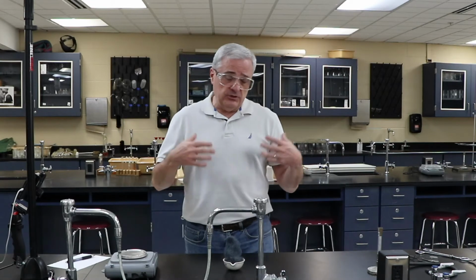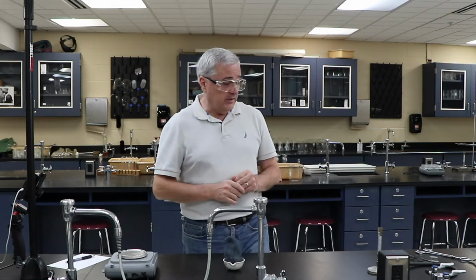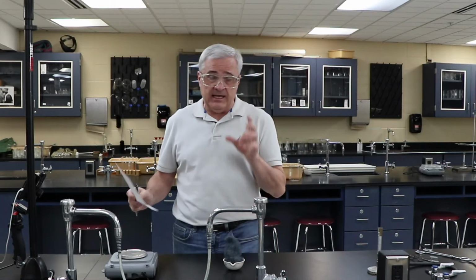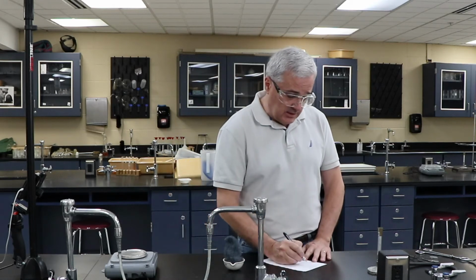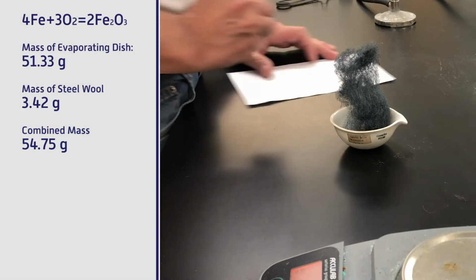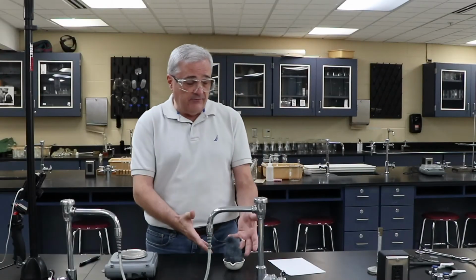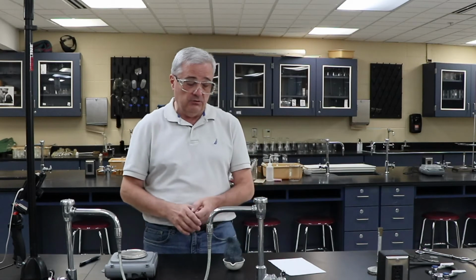All right, if you're still watching the video, you are here for the results. We're going to find out what happened here. First of all, we have to know what the mass of the sample and the evaporating dish was to start with. In this case, it is 54.75. That was the original mass. So originally we had 51.33 for the evaporating dish and 3.42 for the steel wool.